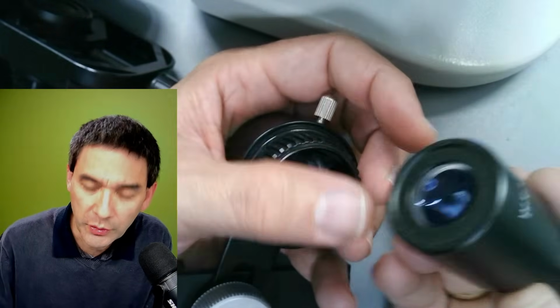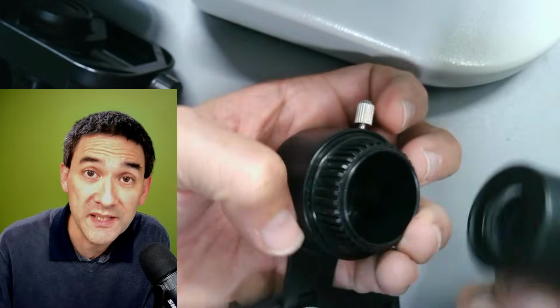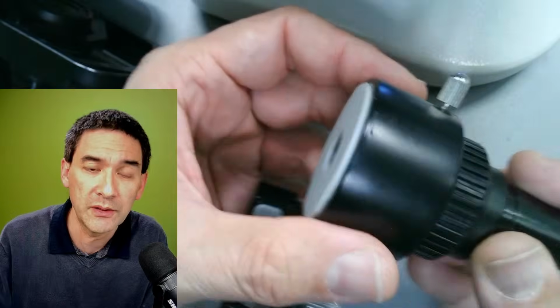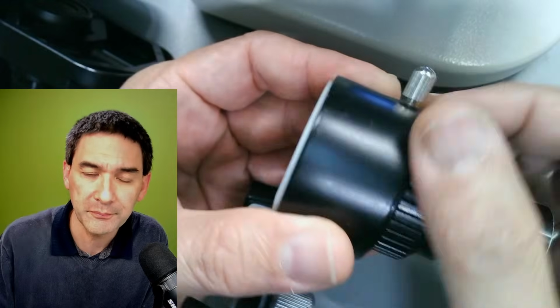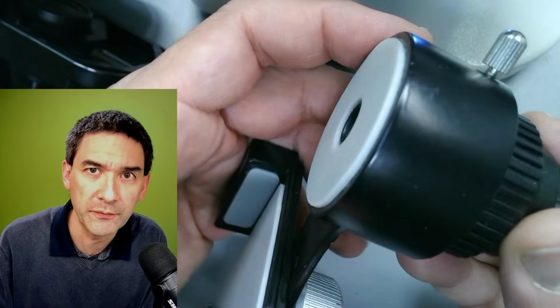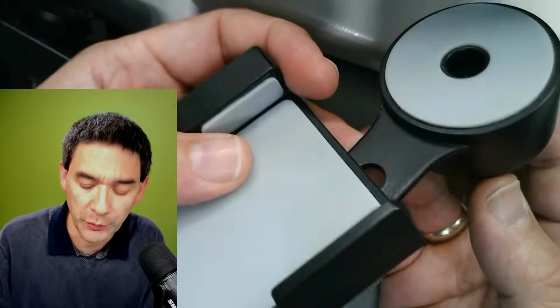So I generally recommend anyway that if you're using any of these mobile phone adapters, you get yourself a separate eyepiece and line up everything first. Then, if you want to use the camera and the mobile phone, you just exchange the eyepiece with the one that's already mounted. Of course, you can insert this directly into the eyepiece of the microscope, or on the trinocular, on the photo tube.